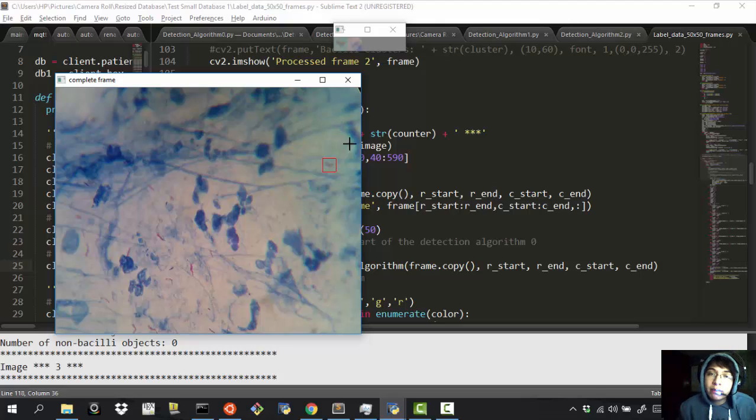We can represent that with the results that we have computed so far in the last two logs. But the problem with this is also the level of specificity. That drops down due to the robustness of the algorithm, which confuses some things with bacteria. That's why we have a low specificity, but we achieved a great sensitivity. Continuing with the same stuff, I showed you the histogram.